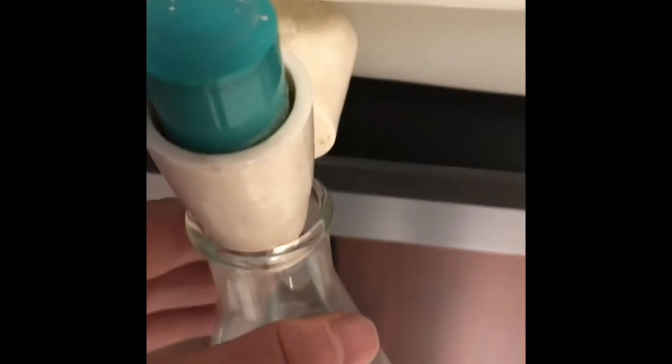So I'll add a little bit of that. And here we go. So I just added a little bit. I'm now swooshing it around, and a lot of that nitrogen dioxide is now dissolved. And also, look at what I have. I've got a copper nitrate solution now, and that color is indicative of copper double positive ions.